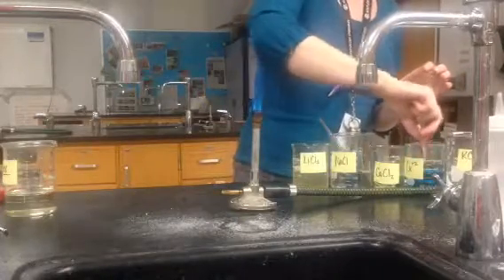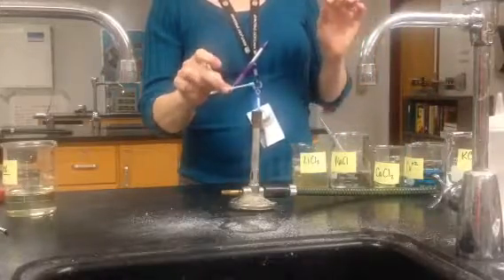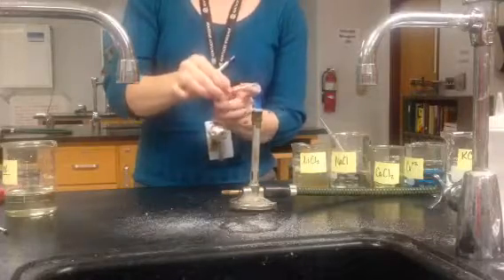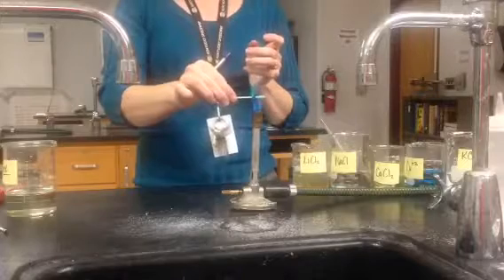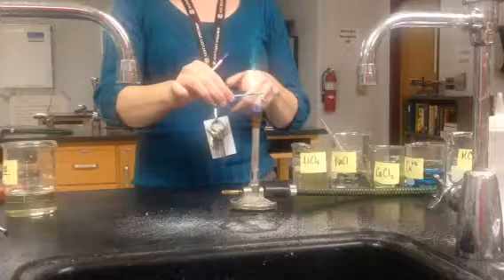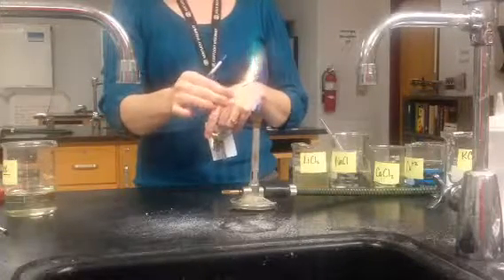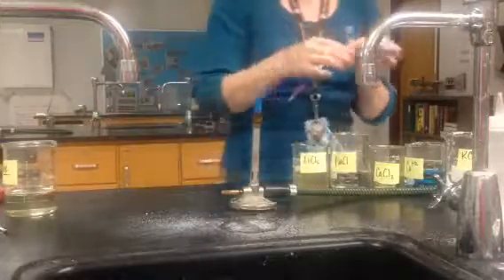The next solution is copper chloride. I'm making a video for any kids that missed today, showing them what we did. You'll notice the copper chloride burns a green color — the orange you might see is where my paper caught on fire, but it burns green for just the chemical. So that cannot be the chemical that killed our classmate.